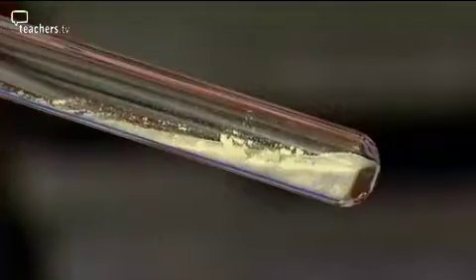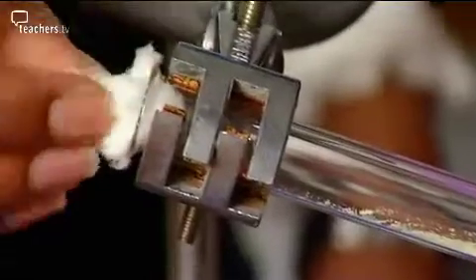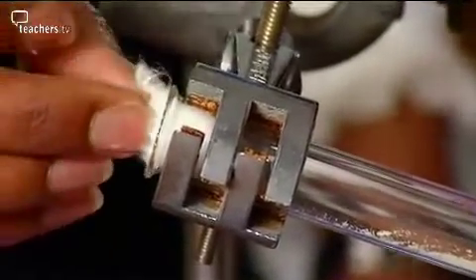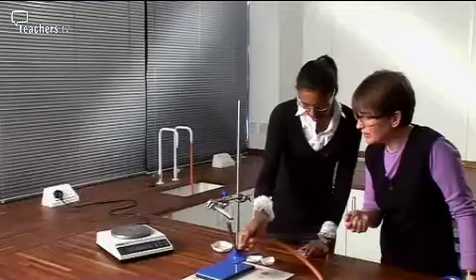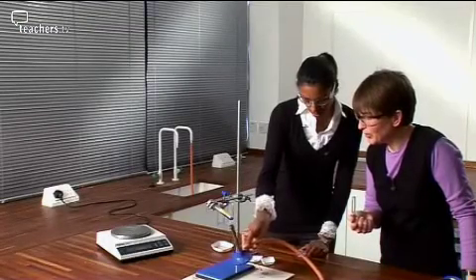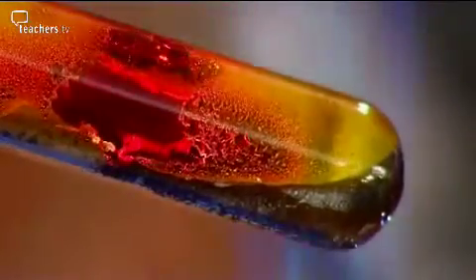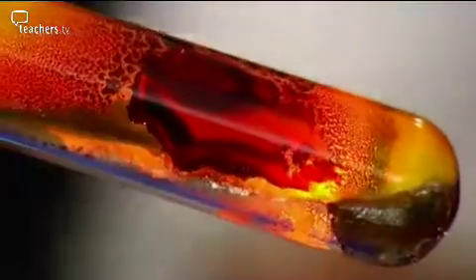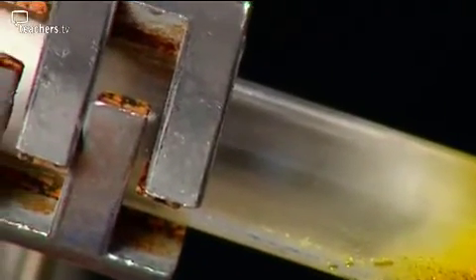So we've got the same amount that you had on your tin lid. Yep. And what we can do is just put a bit of mineral wool plug loosely in the end, and that'll just stop the fumes. And we should get the reaction to go. There, just going now. So you can take the Bunsen away now, and it'll keep itself going. So that's the iron reacting with the sulphur. Right, OK. Iron sulphide. And you can see all the fumes are trapped.